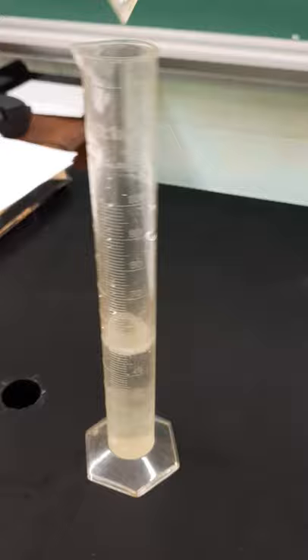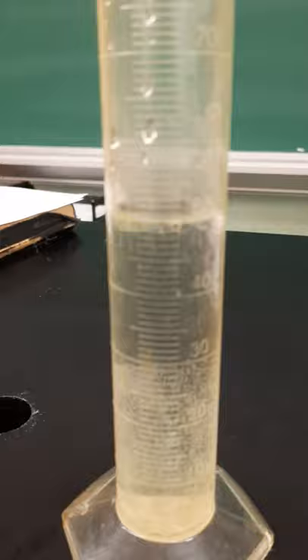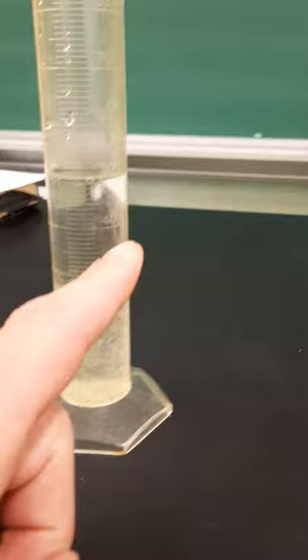We mix 25 milliliters and 25 milliliters, trying to get rid of the bubbles. You always read at the meniscus — and we have exactly 50 milliliters of water.